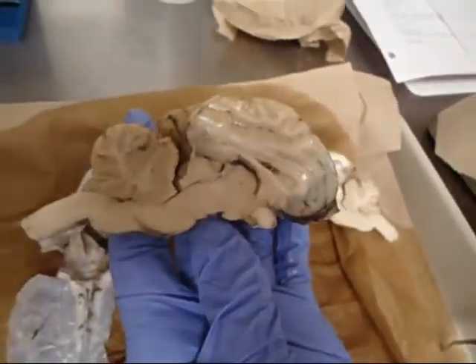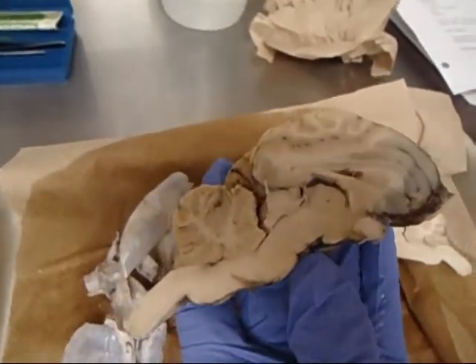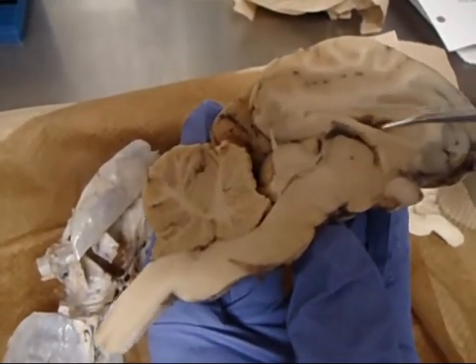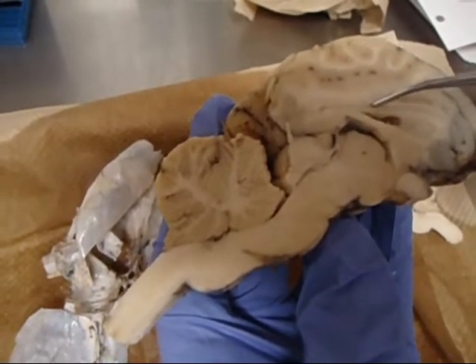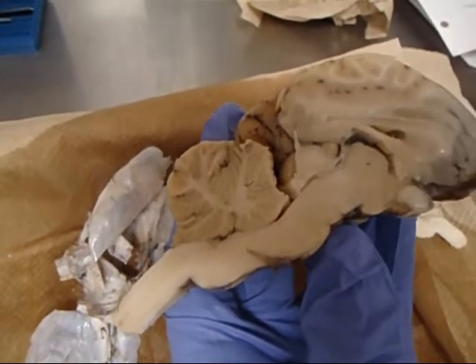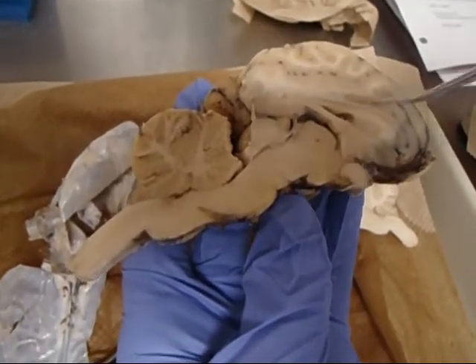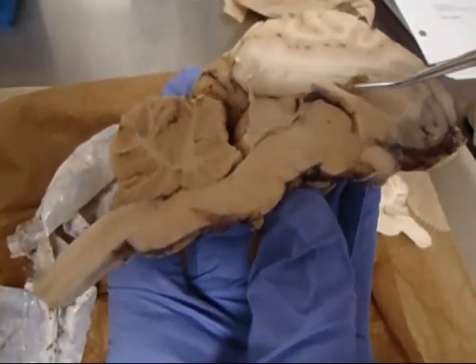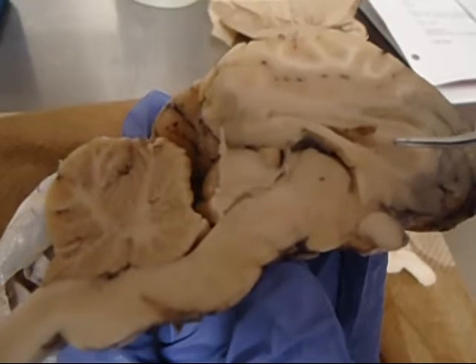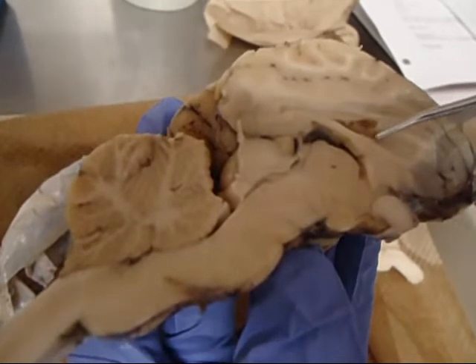Okay, inside the brain, he's going to ask about the ventricles. So you need to know the lateral ventricle, which is horn-shaped. It has a ceiling and a floor. So it's going to be this ventricle here. It's going to run along the top. It has a ceiling, which is the corpus callosum, and it has a floor, which is the fornix. The material inside of the ventricle, that little tiny piece, is the choroid plexus, and it's going to be inside any of the ventricles, but typically the lateral ventricle is the one he pulls it from for the test.